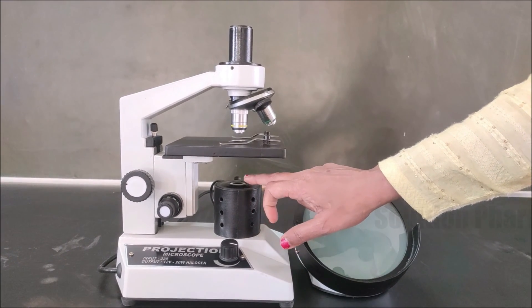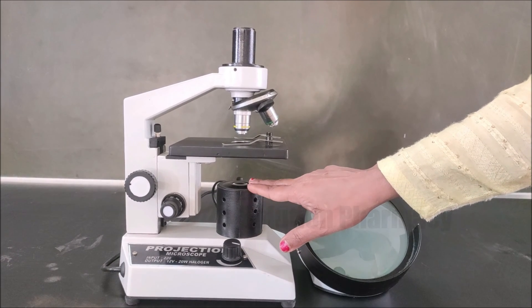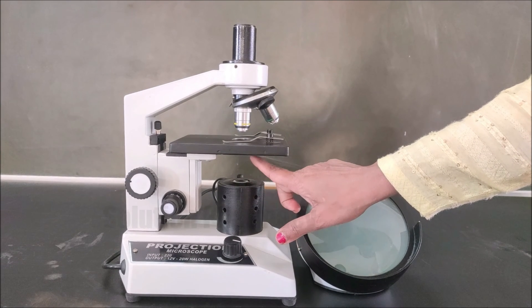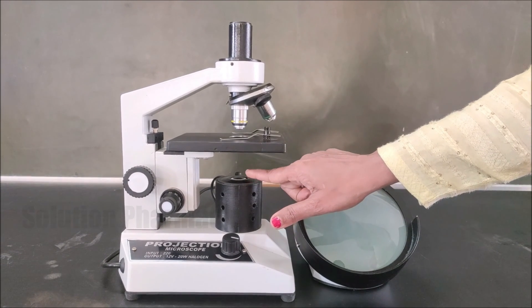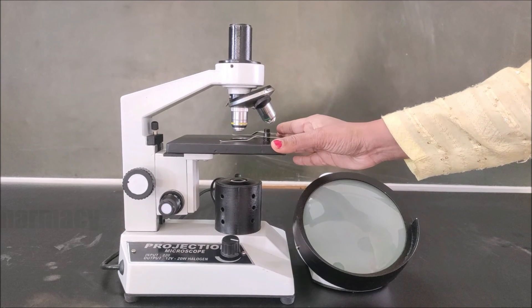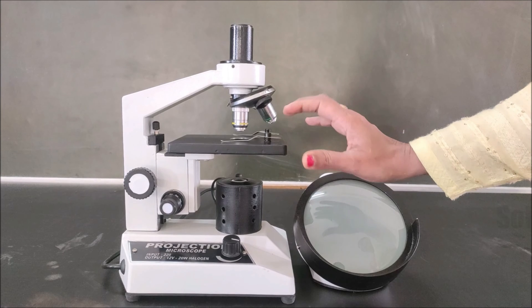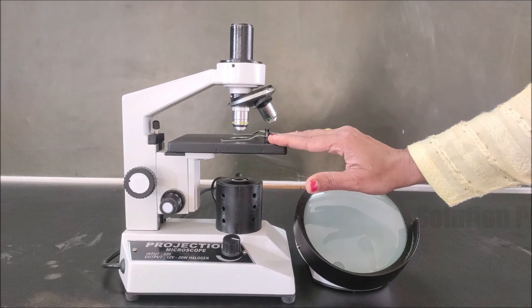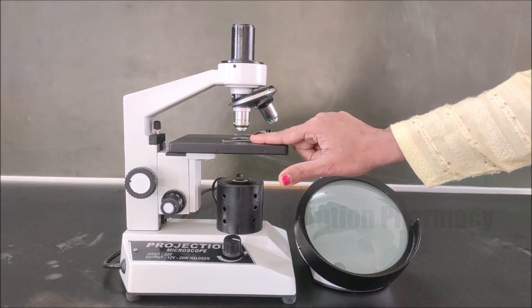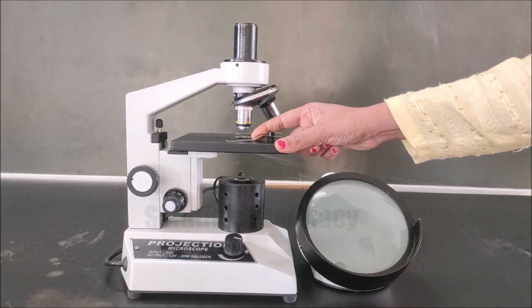This part is called the illuminator — it is the light source from which light focuses on the specimen on the slide placed on the stage, illuminating it through the base of the microscope. This is the stage of the microscope on which we place the slide containing the specimen, such as plant tissue, animal tissue, microbes, or any other sample. We first prepare the slide and then place it on the stage.